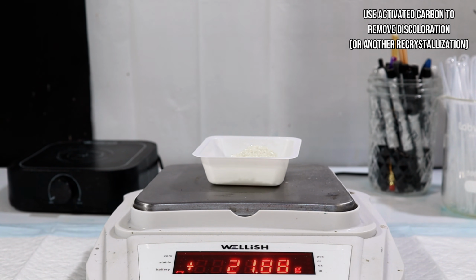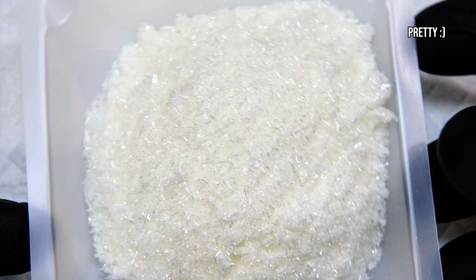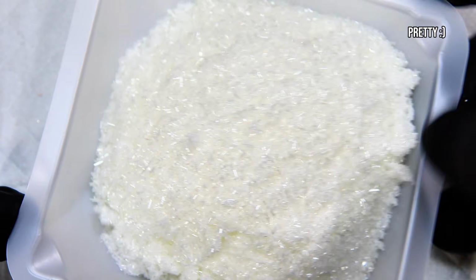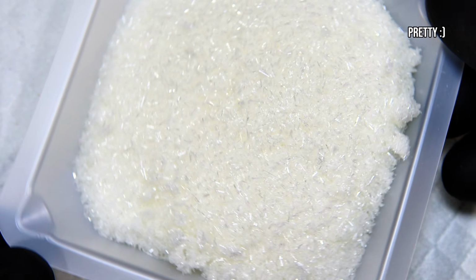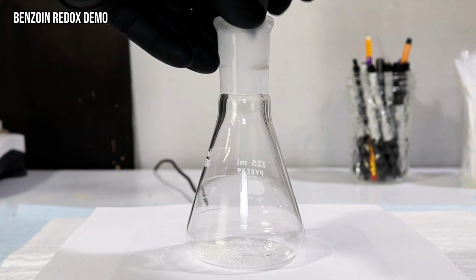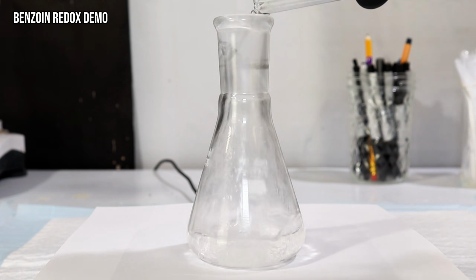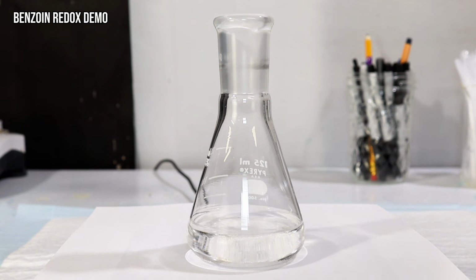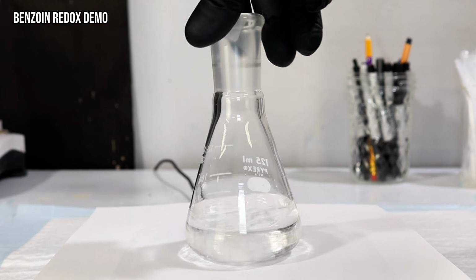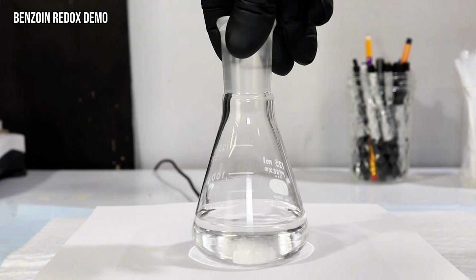As a quick side note, before I did the reaction the way I showed here, I did a preliminary trial run using some extra benzaldehyde that I made by the oxidation of benzyl alcohol using nitric acid. In this first run, I very closely followed the formal procedure for this process, and so I didn't add any extra hydroxide as the reaction mixture lightened. I also heated the mixture directly on my hot plate and didn't allow the mixture to cool overnight. While doing it this way was way quicker, my final yield was only around 52%.